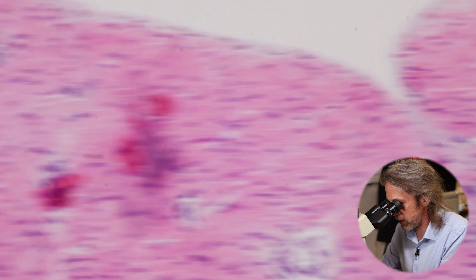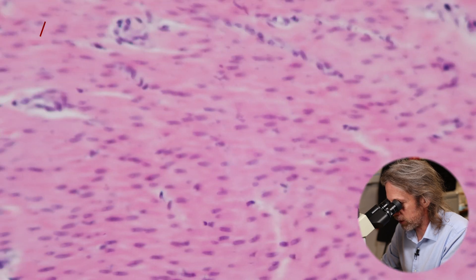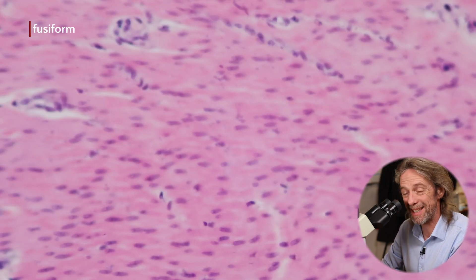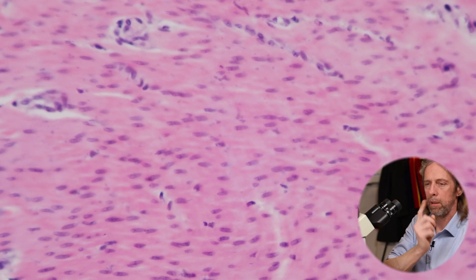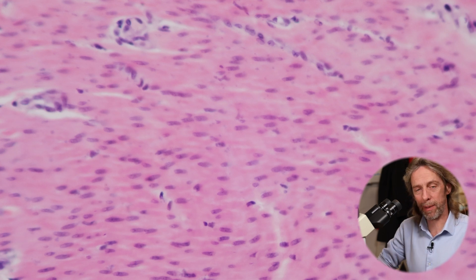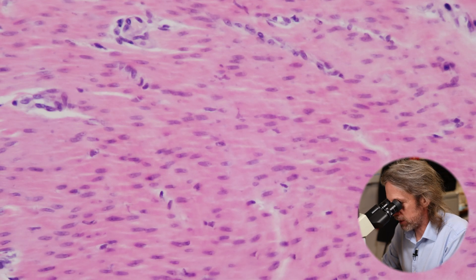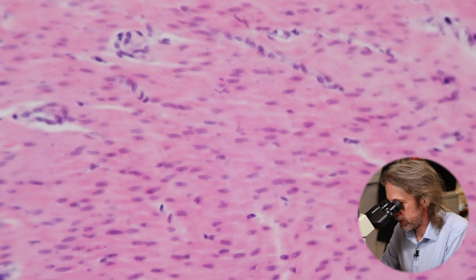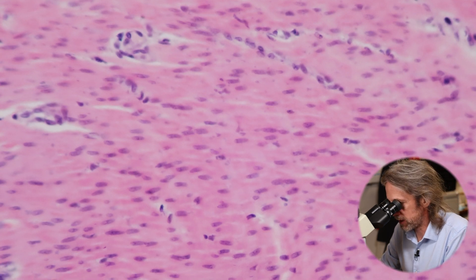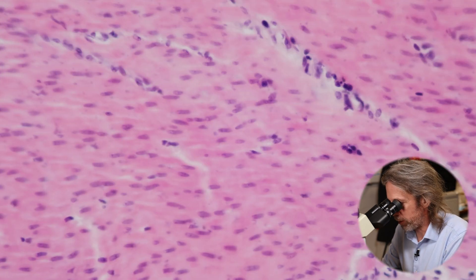You can see cells linking together running in the same direction. Smooth muscle cells are individual cells described as fusiform, which means spindle-shaped - a spindle is fatter in the middle and narrower at the ends. So these cells are maybe 10 microns wide at the fattest point in the middle and then taper, being narrower at the ends. They're all packed together with the nucleus in the middle.